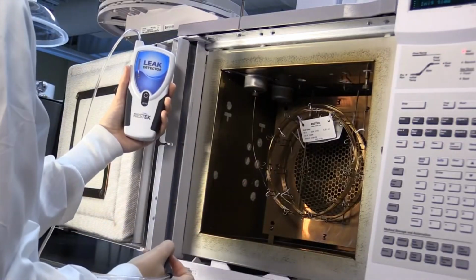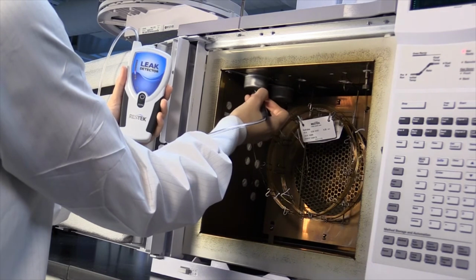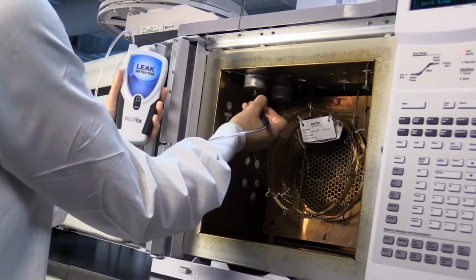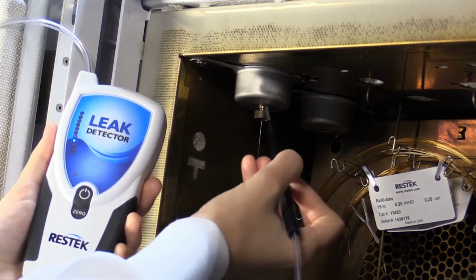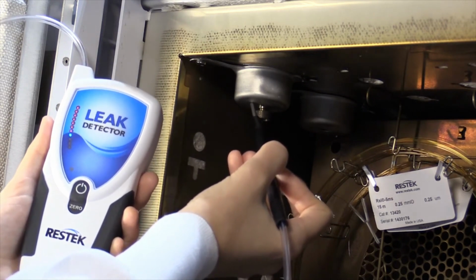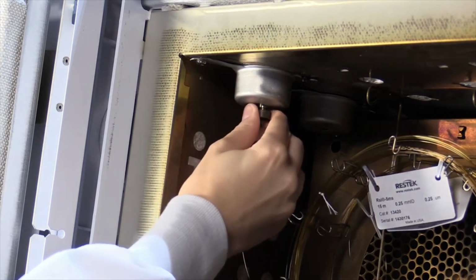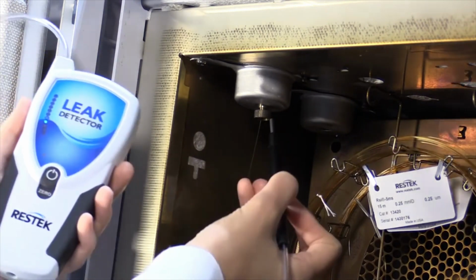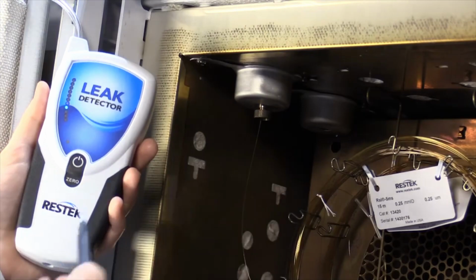Leaks around the bottom of the inlet, specifically the reducing nuts, column nuts, and detector nuts, are common, especially since temperature cycling can loosen nuts that are not properly tightened. In addition, ferrules, especially Vespel graphite blend ferrules, tend to shrink slightly after initial heating cycles, which may also lead to a leak. If you encounter a leak near the column nut, reducing nut, or other threaded connection, first attempt to fully tighten the nut. After the fitting has been tightened, recheck it to confirm that the leak has been eliminated.